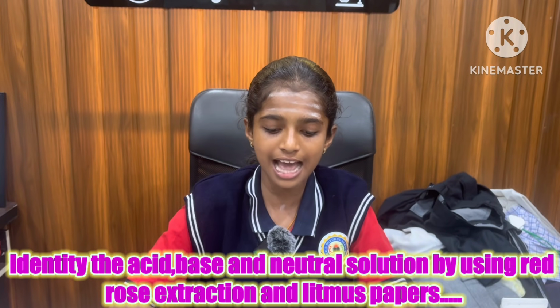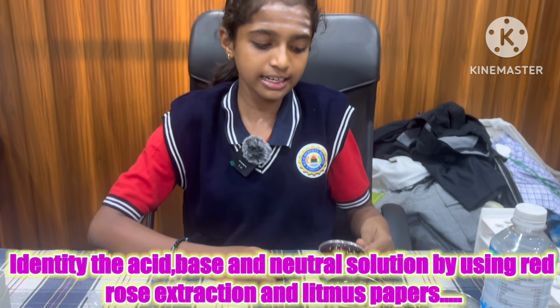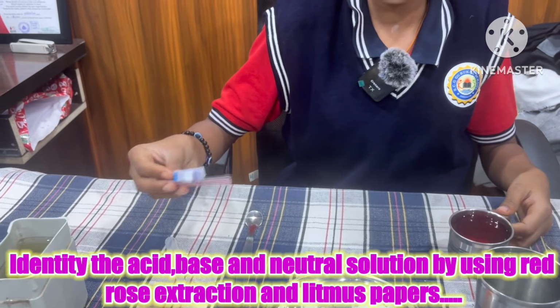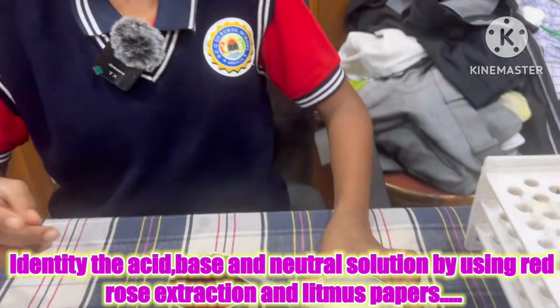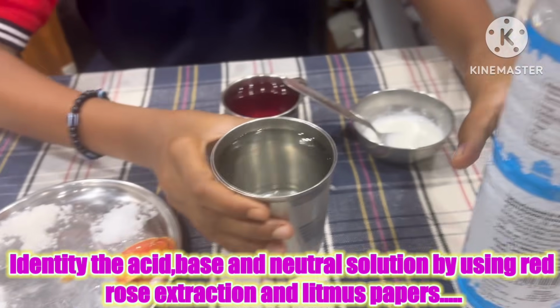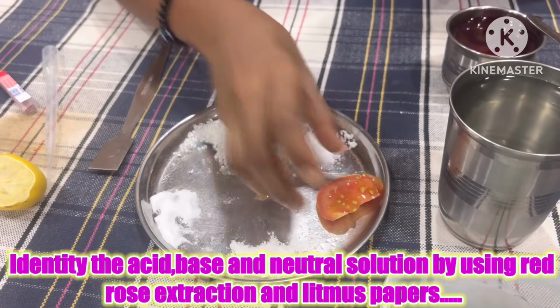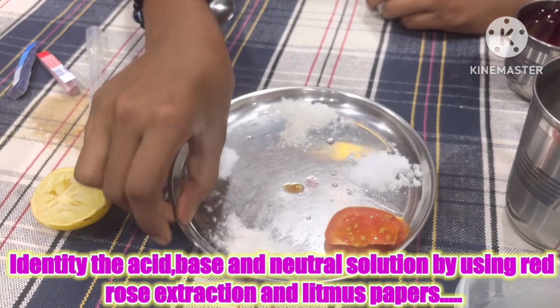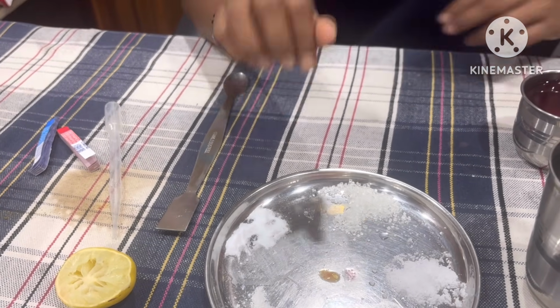This is the experiment of identifying acidic, basic, and neutral substances. I take the indicators of red rose extract and litmus papers, and I took solutions of curd, vinegar, water, soap solution, tomato, lemon, washing powder, salt, sugar, and baking soda.